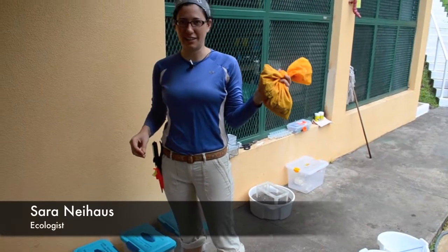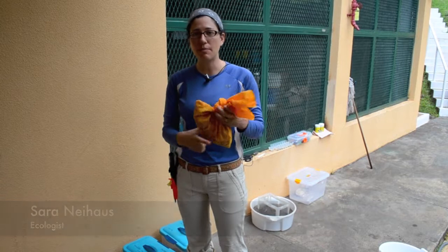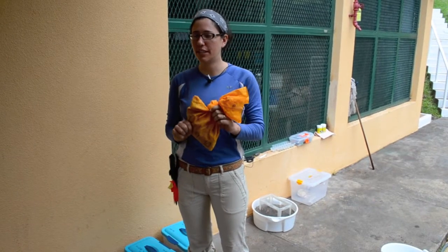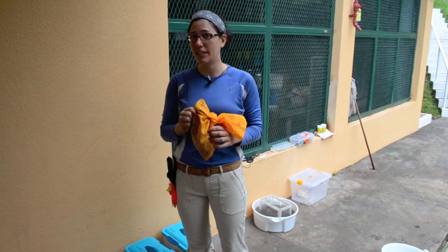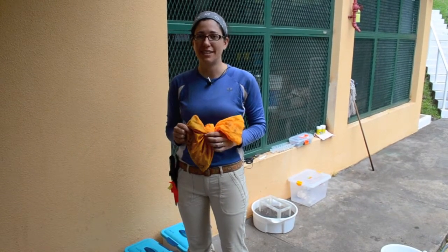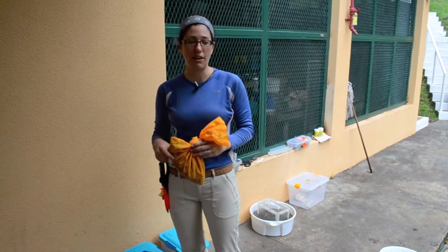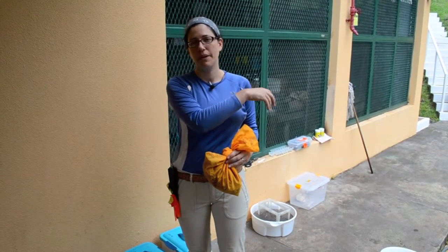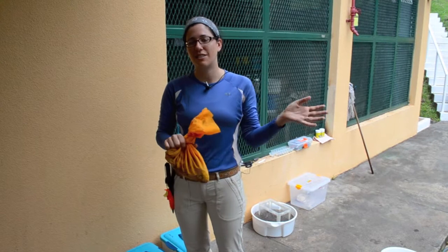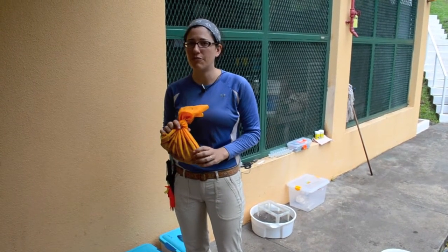This is a sample just like the one we just collected. And the first step, so remember when we collected this sample, this didn't just have leaves. It had the leaf litter, and then it also had soils. Especially in the litter addition plots, where some of the leaf litter on the ground has been raked up and moved, it has more soil stuck to it than normal. So this is something we had to take account for.